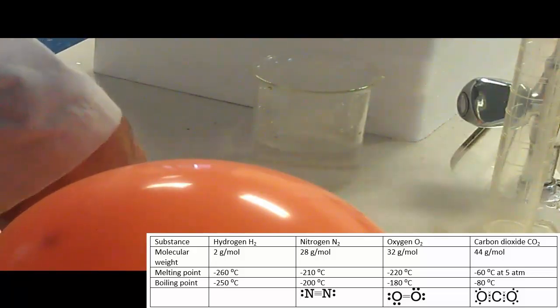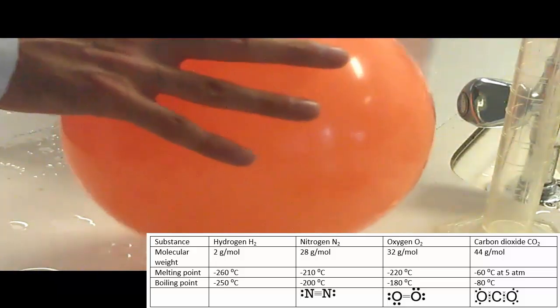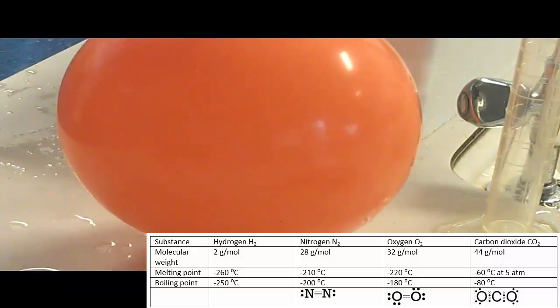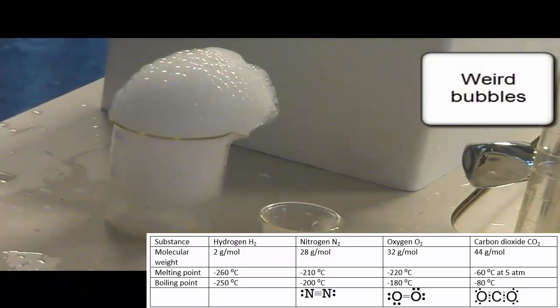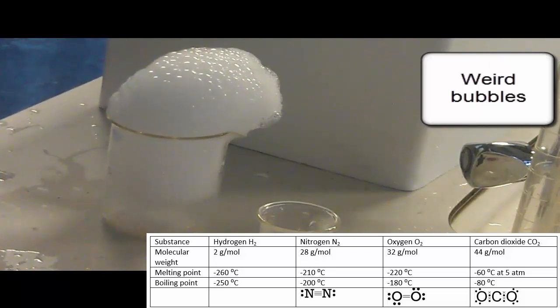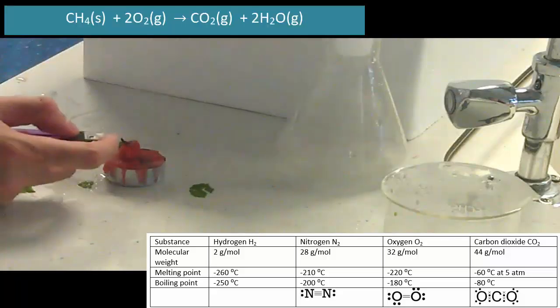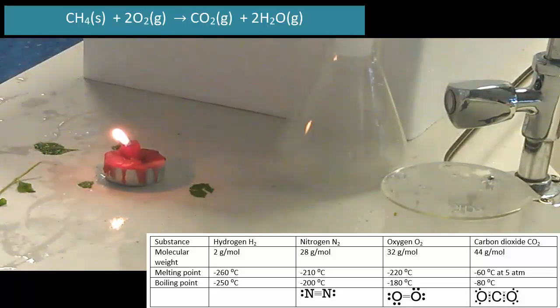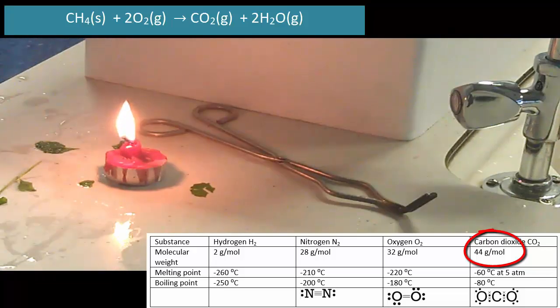The other thing you can do is put a little bit of soap in there, and the bubbles will also be weird. Instead of floating up, you can see that the bubbles are heavy and they just drop down and fall over into the beaker. That's it. So knowing that carbon dioxide is heavier than air, you can see there the molecular weight. Sorry, I forgot to mention it's 44, whereas oxygen's 32 and nitrogen's 28.